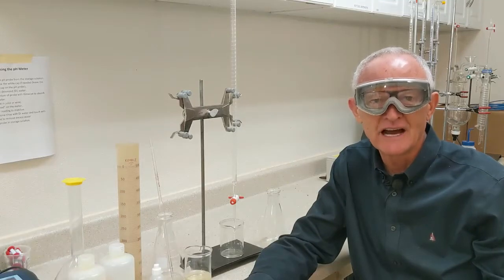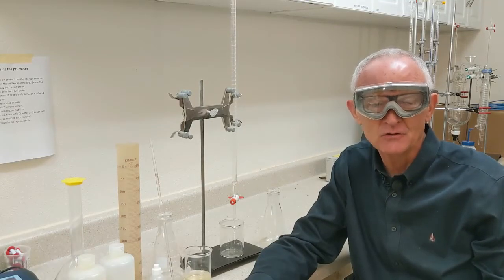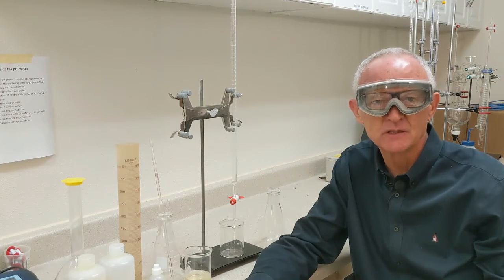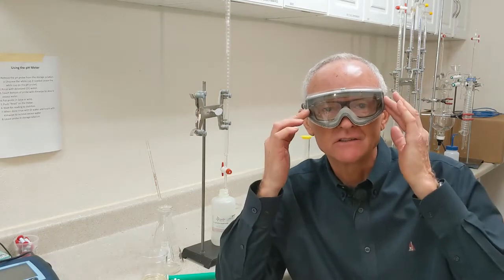Hi everyone. I'm here in our wine lab at Chone Farm to test titratable acidity. First things first with testing titratable acidity, safety goggles.